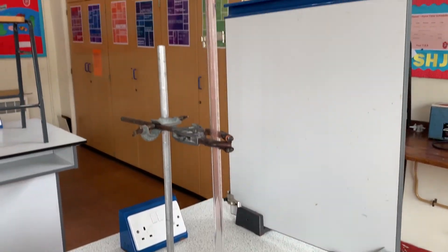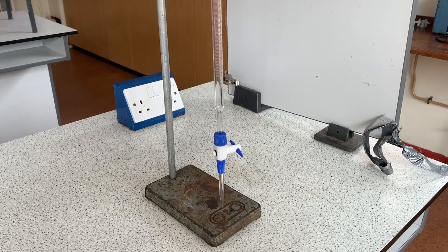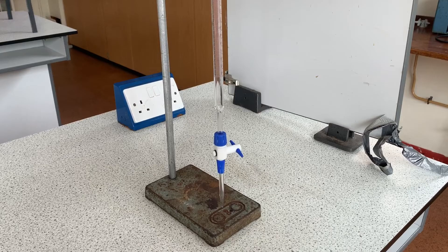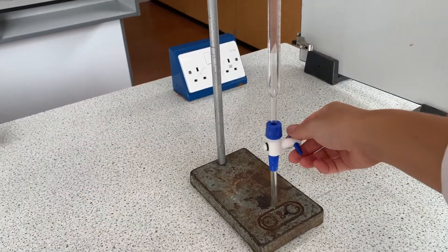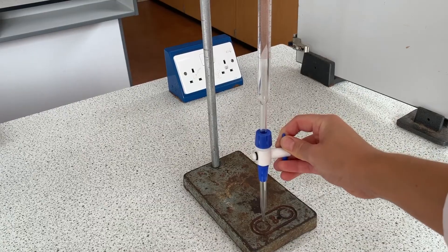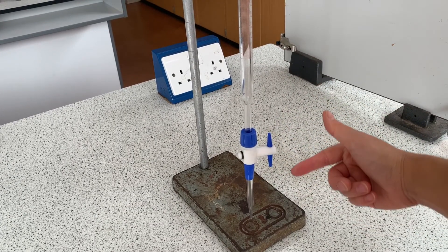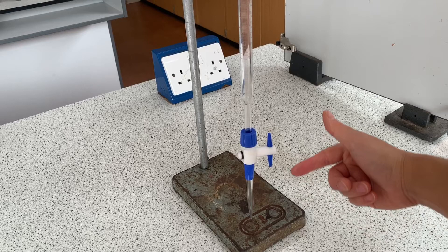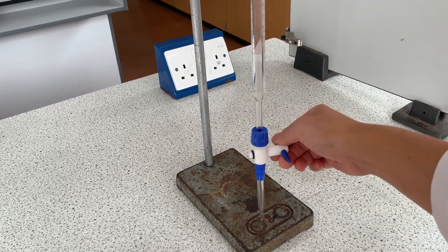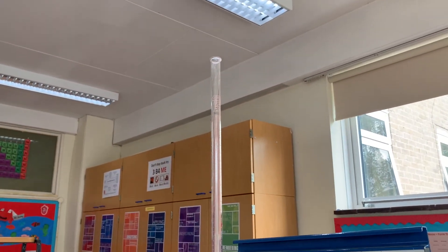Next I need to fill the burette with sulfuric acid. First I need to make sure the tap is closed. If I turn it 90 degrees, the tap runs in line with the burette — that means the tap is open and liquid can flow straight out. So make sure the tap is perpendicular to the burette before you fill it.